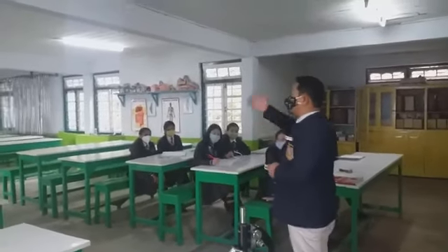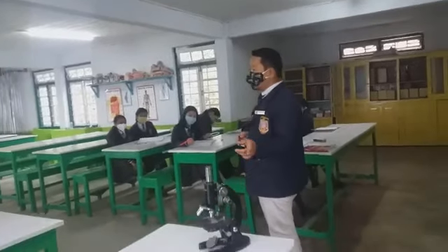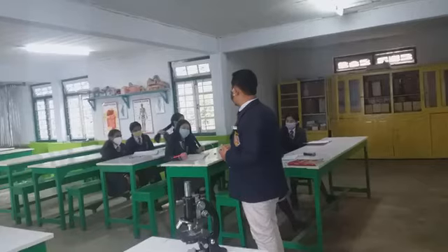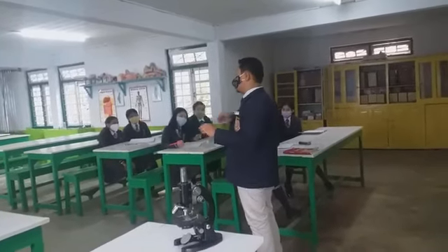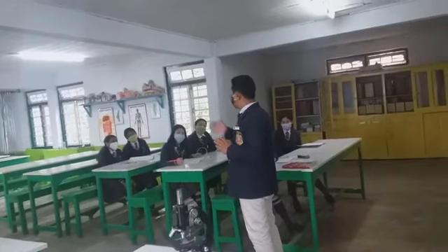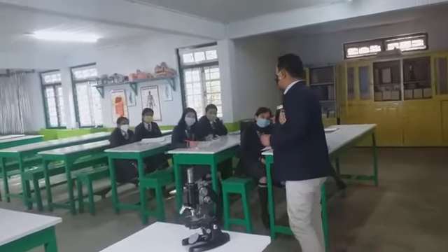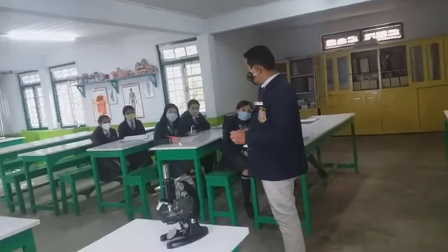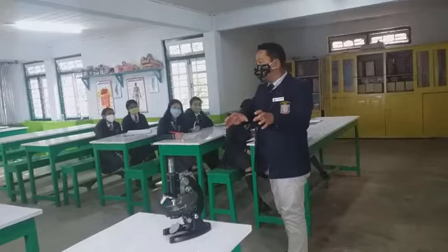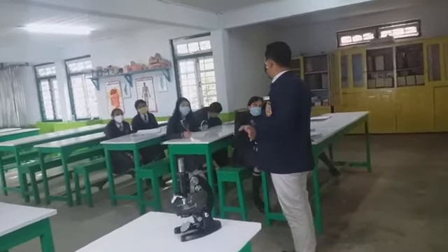As you go to college level classes, you have to prepare the slides by yourself. There are two types of slides we make, temporary and permanent. So this is your permanent slide, which we can use afterwards also. You can use it for many years. Today, because of lack of time and due to some technical tricks, I have already adjusted it here and made you see under the microscope. I hope you all have seen it.